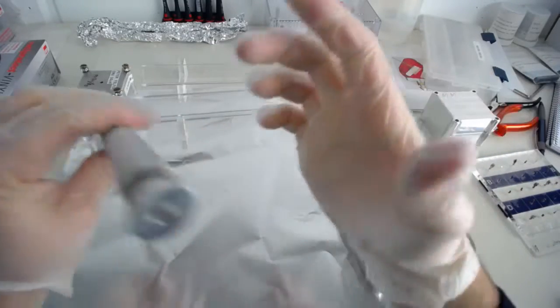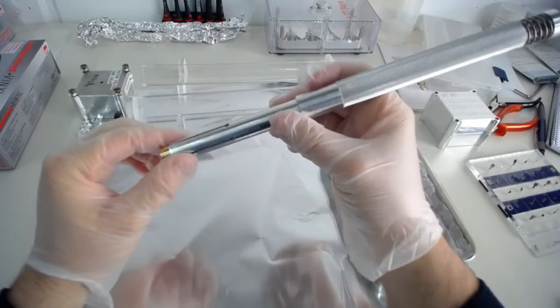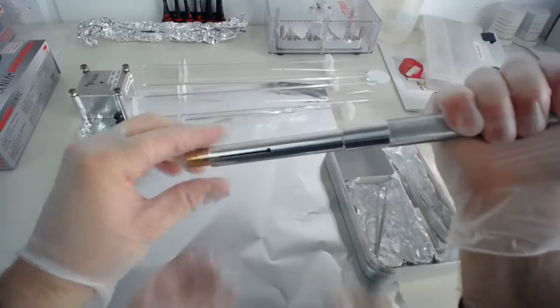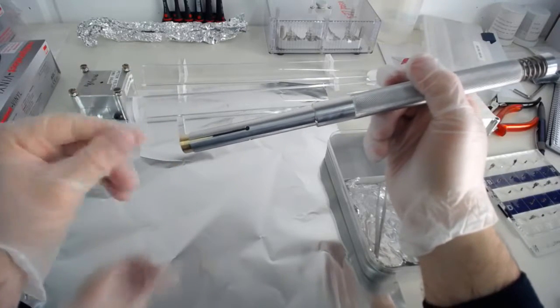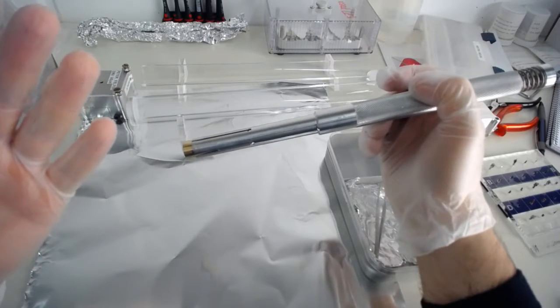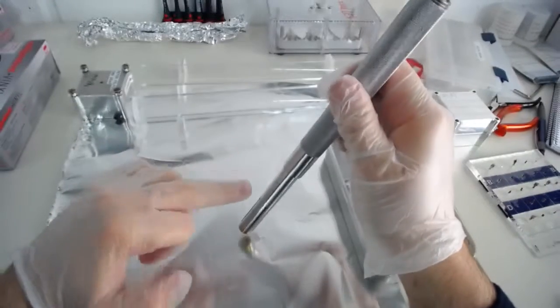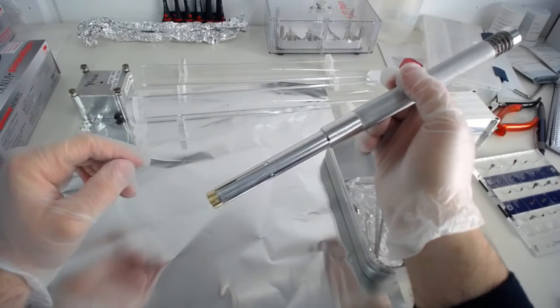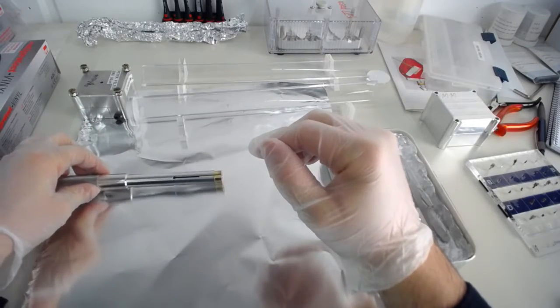Of course, here, same thing as we had with the aluminum foil. If you do that, there will be wear on it, which means over time there's little flakes of brass coming off. And the brass should also not go into your ultra-high vacuum system either. If you just went over it, you will see there's brass flakes everywhere. And you don't want them to go into your ultra-high vacuum system. The end, you also should not touch with your gloves, even if your gloves are clean. If it gets dirty or from time to time, a good idea is to put it up to here into a bath of isopropanol or methanol and sonicate it for half an hour and then dry it afterwards.